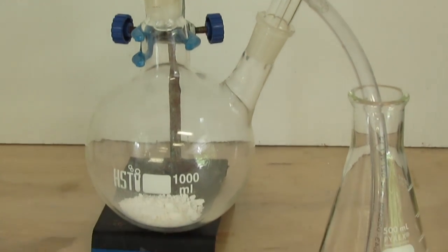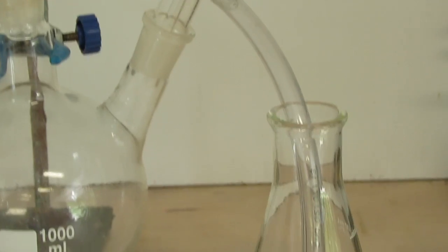Here I have a simple chlorine generator, an addition funnel which will be dropping hydrochloric acid onto some trichloro-isocyanuric acid tablets.